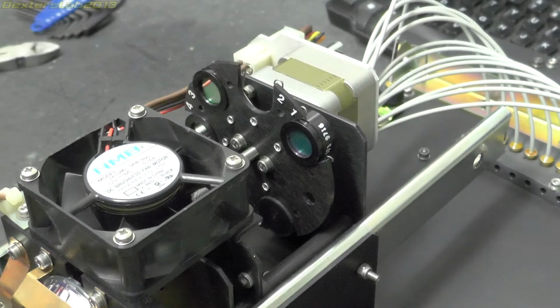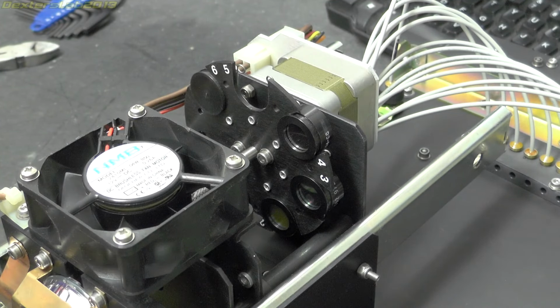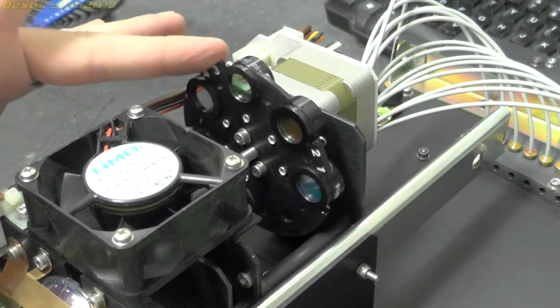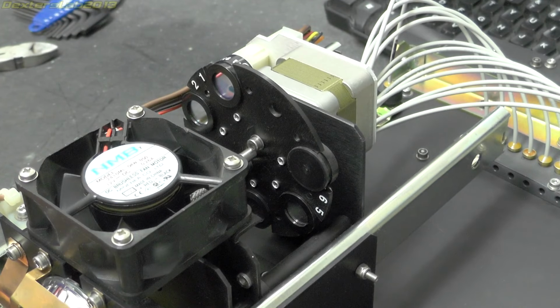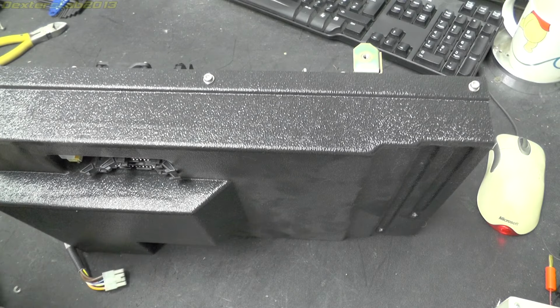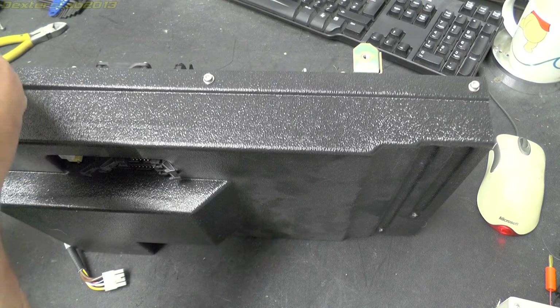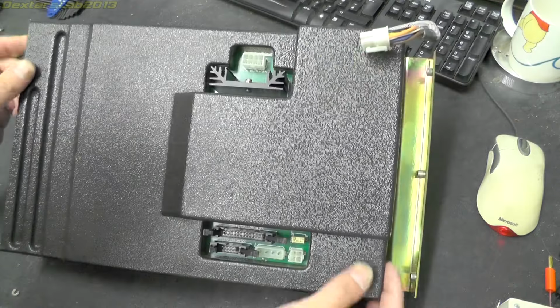If I put this up to the camera there, you can see it turns the image blue. That one's an even darker blue. You can probably hardly see anything there. This is 650, and you can see there it's red. So yeah, this just spins around and selects the colour that you selected for the filter in the user interface. Right, let's take the plastic cover off the main guts of it, and we'll see what interesting things there are inside. Take the lid off.